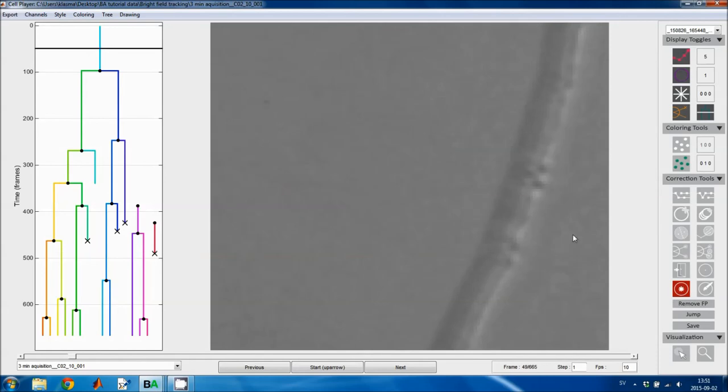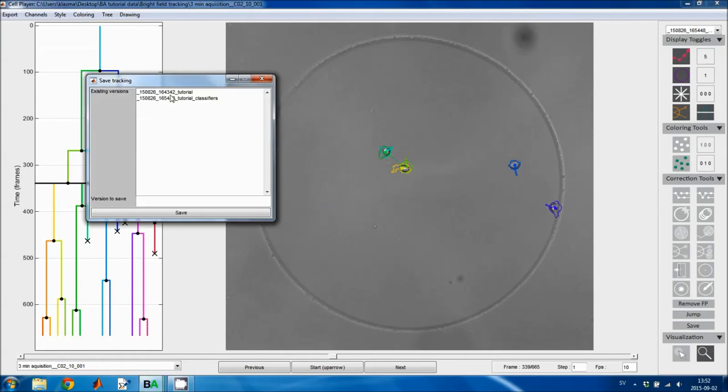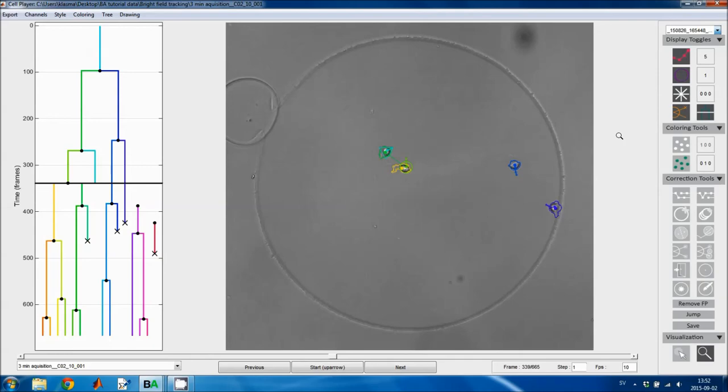And then the jump tool will move to the next frame where the number of cells changes, and that can be useful if you have only a few cells like this. If I press this button, I go to this cell division event. If I press it again, I move to that, and so forth. And then this save button is used to save your tracking results, but I won't save them now. Now I'll just reload the tracks so that we can correct the actual tracking mistakes in them. Don't want to save these.